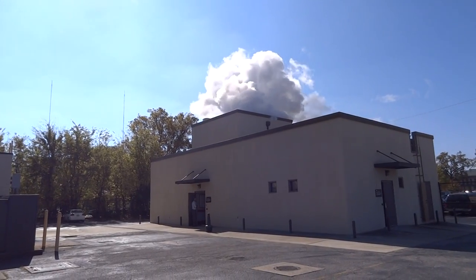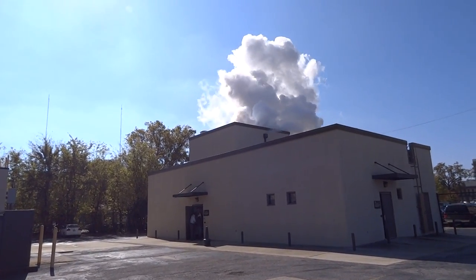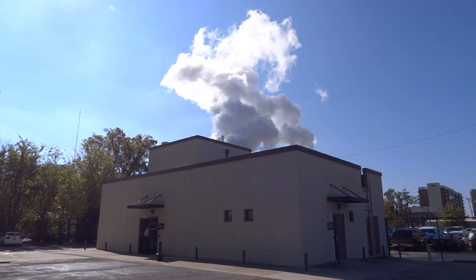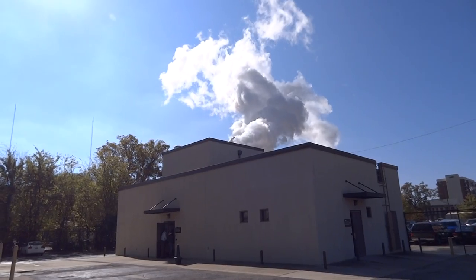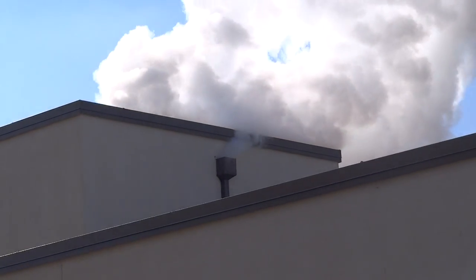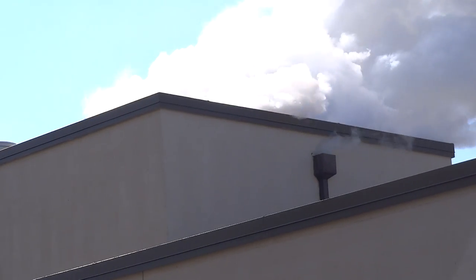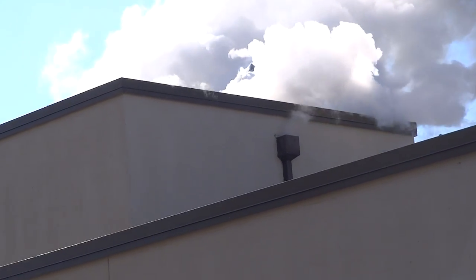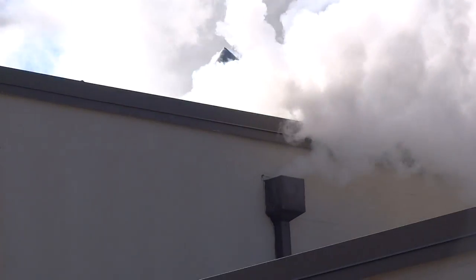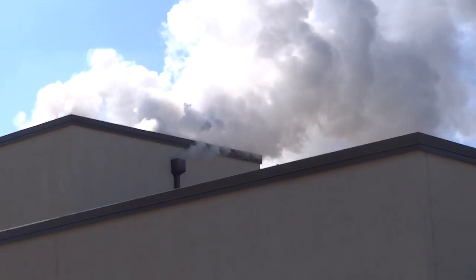Oh, wow. That's about 30 grand worth of helium. Yes, that is a lot of helium. A little small blip with that. Mm-hmm. A couple of zeppelins. Yes? Come here! Are you kidding me? Are you kidding? Jesus!